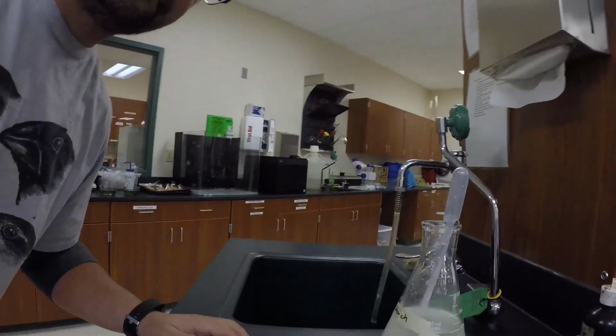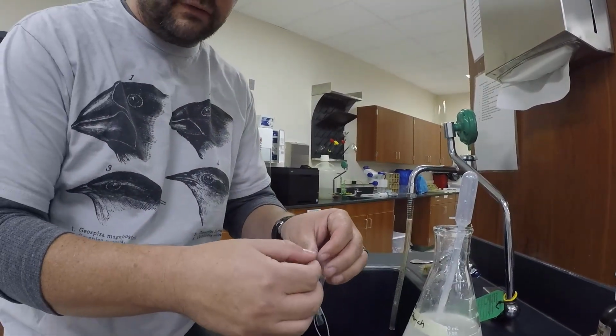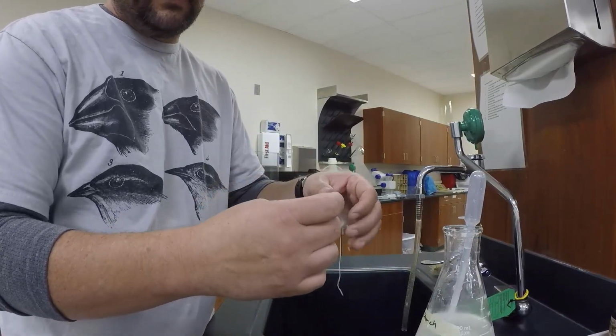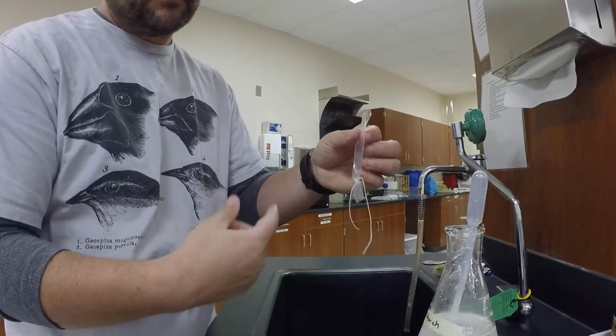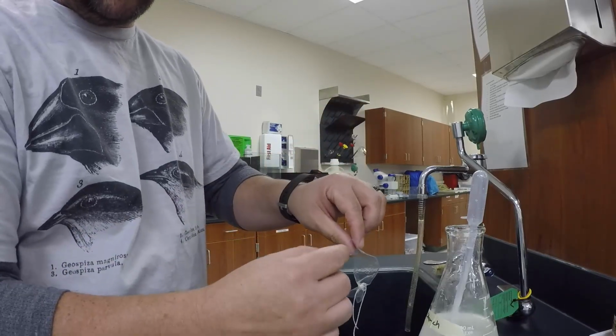So I'm going to first show you how I'm making semi-permeable membranes and how I'm making a makeshift cell. So you can think of this as a cell structure, or makeshift cell. I'm going to demo this real quick. Alright, so right now I have some dialysis tubing that we've cut into sections here. And dialysis tubing, as the name implies, is hollow. It's tubing. So I've tied off one end with a piece of string, and then I open the other end so I can insert some stuff.